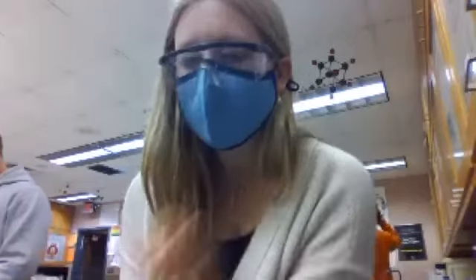So we're gonna rinse out the burettes or whatever they're called, and then do the acid stuff, and then take the pH of the acid, and then you guys need to find the H plus, and you would do inverse log of negative the pH to find the H plus.